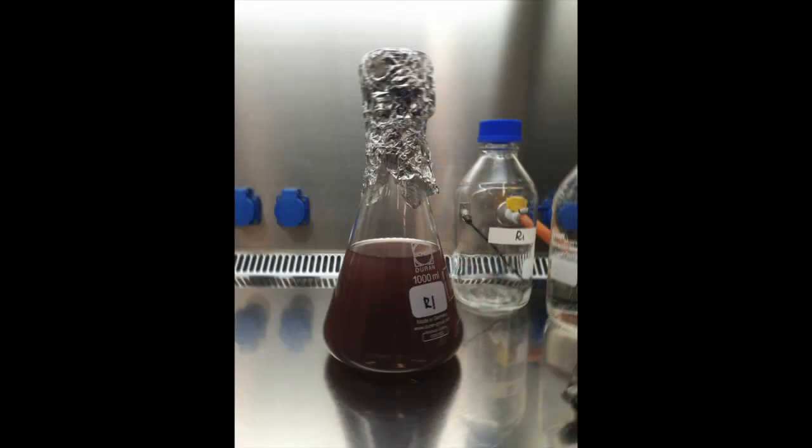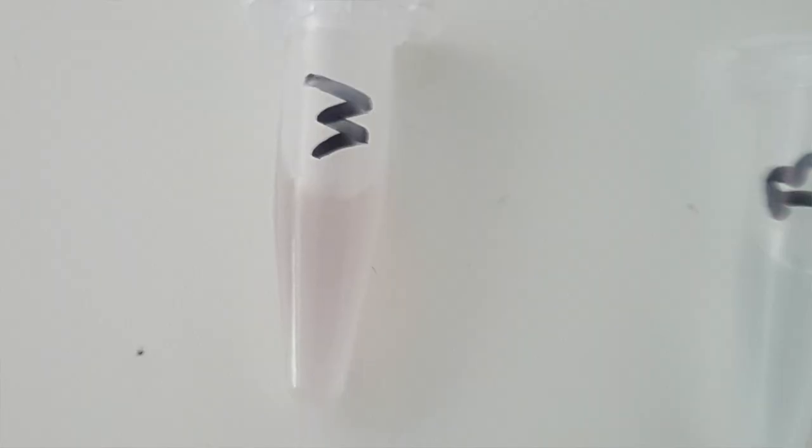So let's assume that you already saw that video and that you know how to produce the inoculum. So we have our inoculum ready. We have already filtered it. And here you can do two things. You can count directly, but it will be difficult because, as I mentioned, there are many spores. So usually you can make dilution series.